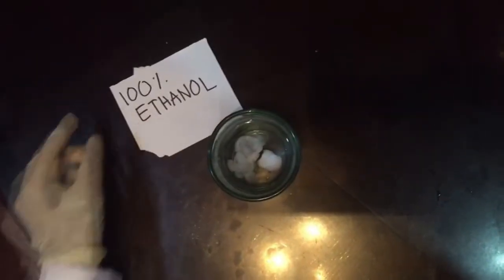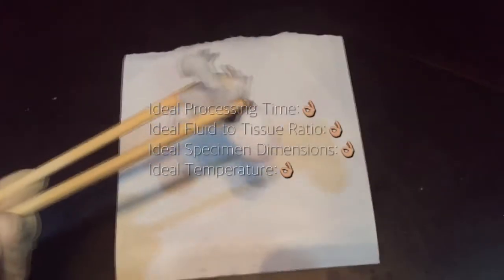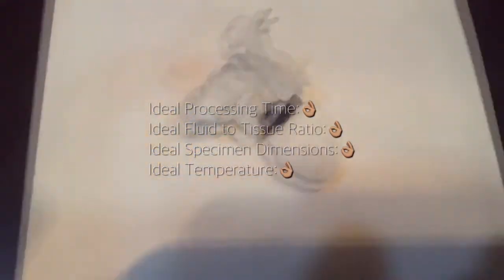After 45 minutes of waiting, we can now say our specimen has been dehydrated. And since we followed the ideal time, the ideal fluid to tissue ratio of 10:1, and the ideal temperature, we can now say that our sample is ready to go to the next step.